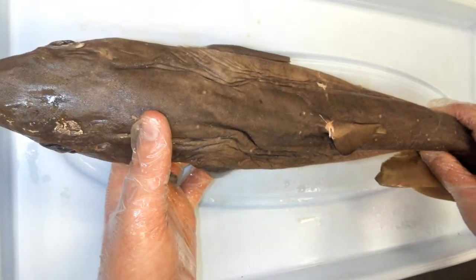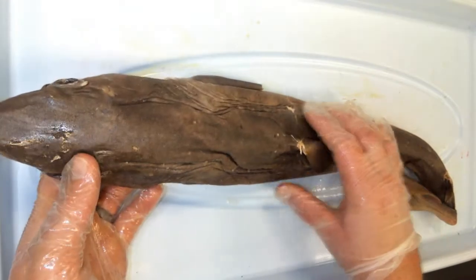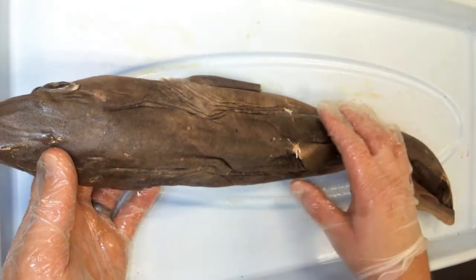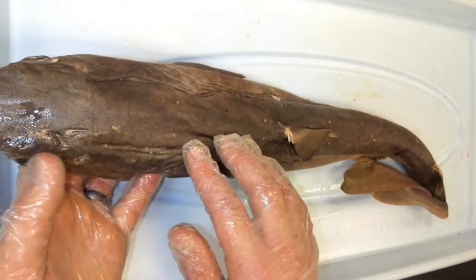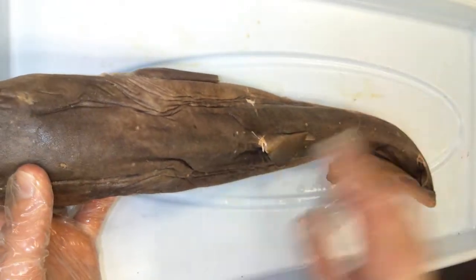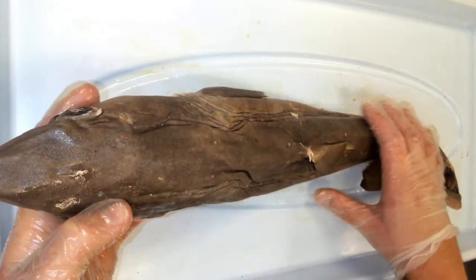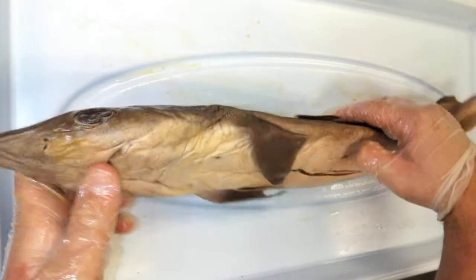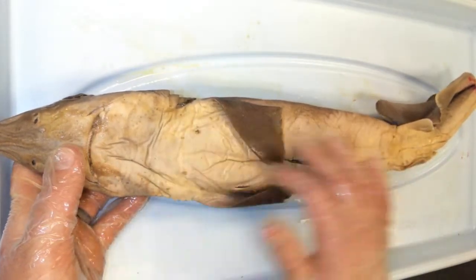Along with their streamlined body shape, this allows a shark to swim pretty fast through ocean water. Some other notable features: if we look carefully at the dorsal side on top, there are some white dots. The dorsal side of the shark is dark gray, and if we look at the ventral side, the color is a lot lighter.